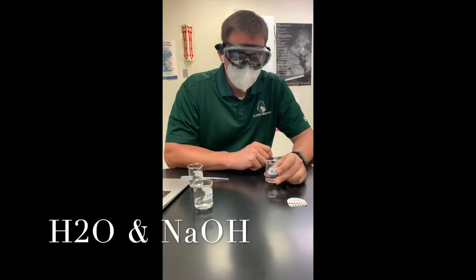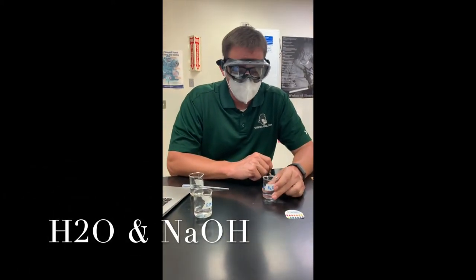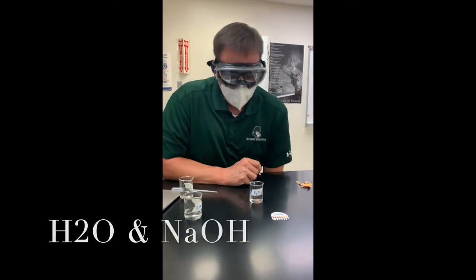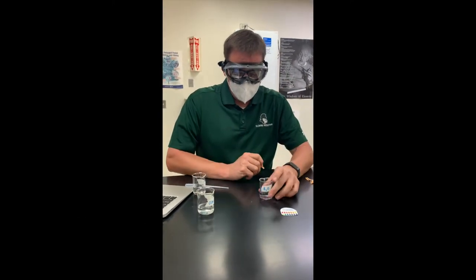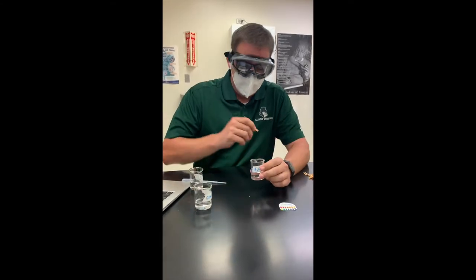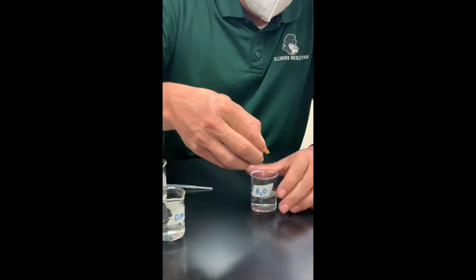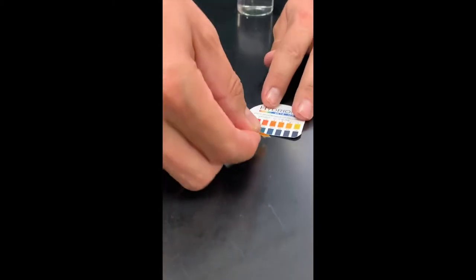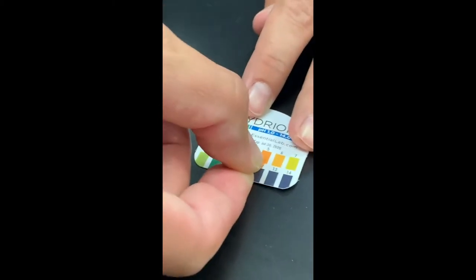Good morning. Today we are going to be learning about what buffers do in regards to acids and bases. What we have here first is a beaker with some water in it, and I'm going to use this pH paper to take the pH of our water. This is our distilled water that we've got in class.